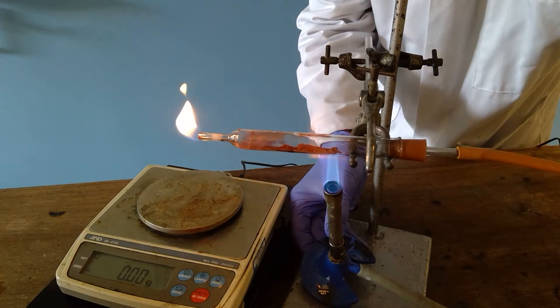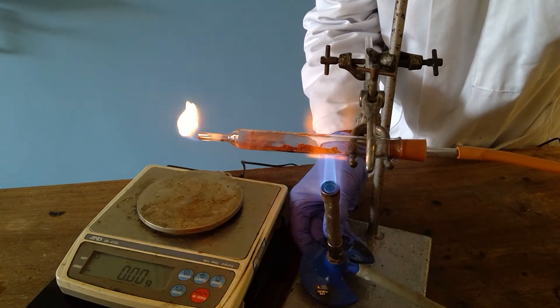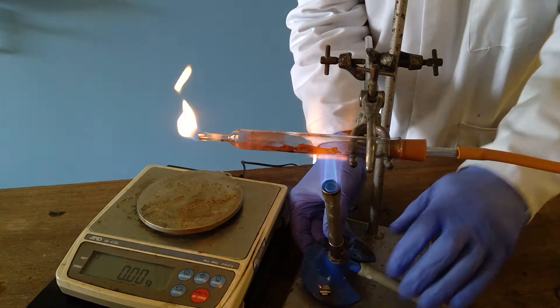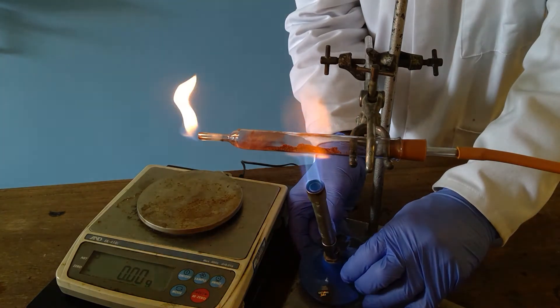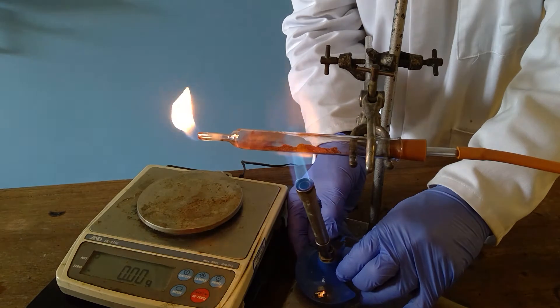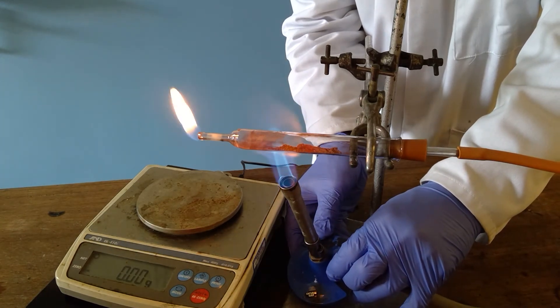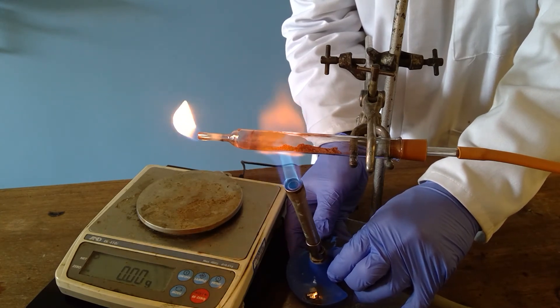Absolutely at full pace on the Bunsen now. When we finish this experiment the chances are not all of the oxygen will have been picked up by the hydrogen, so not all of the copper oxide will have been converted to copper.